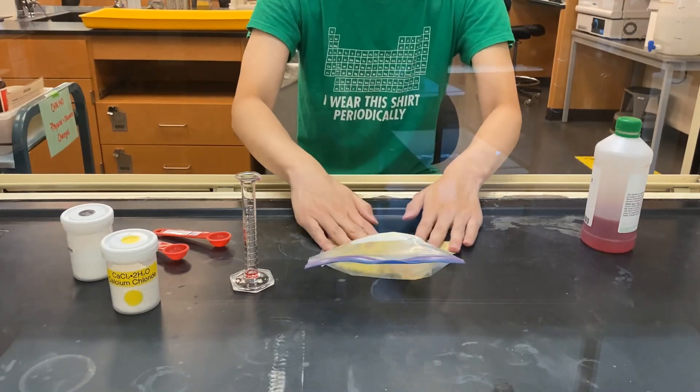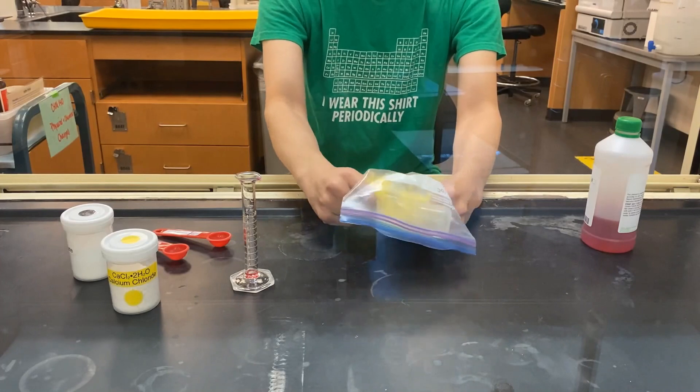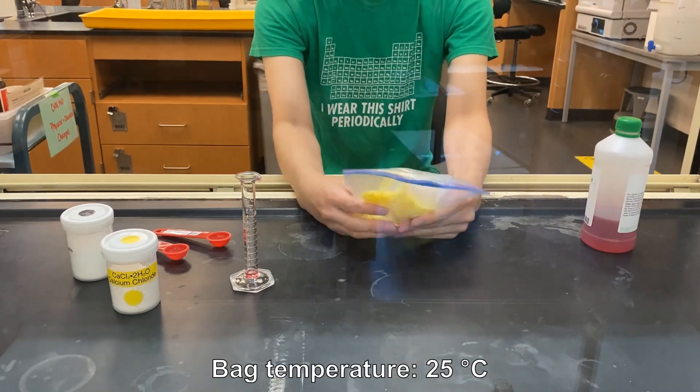Note any temperature changes, any color changes, and what is happening to the bag itself.